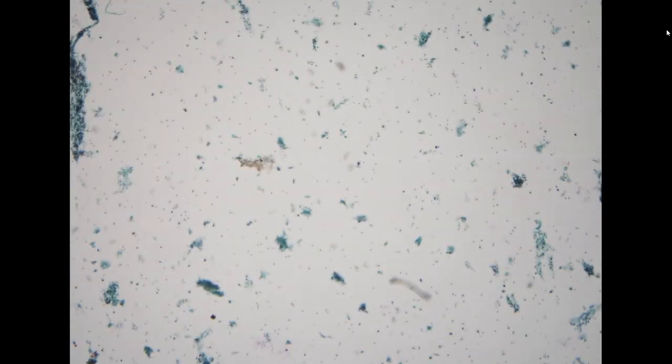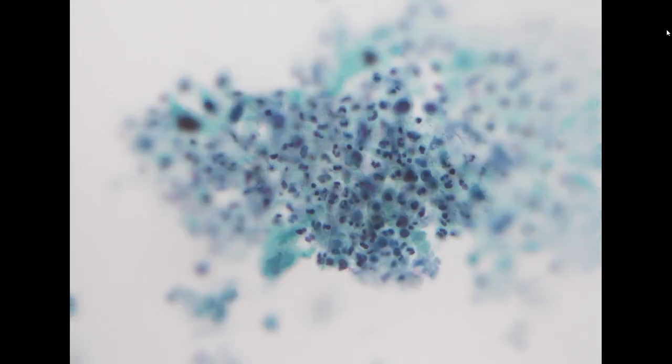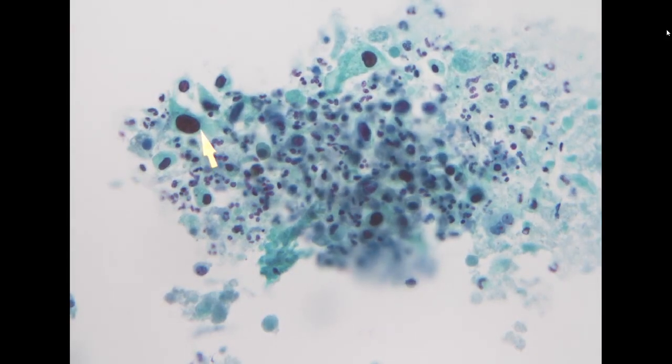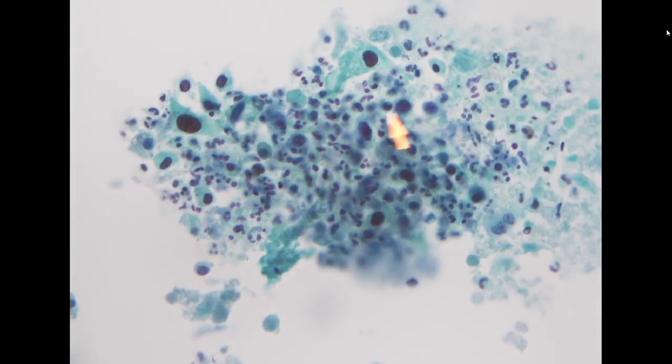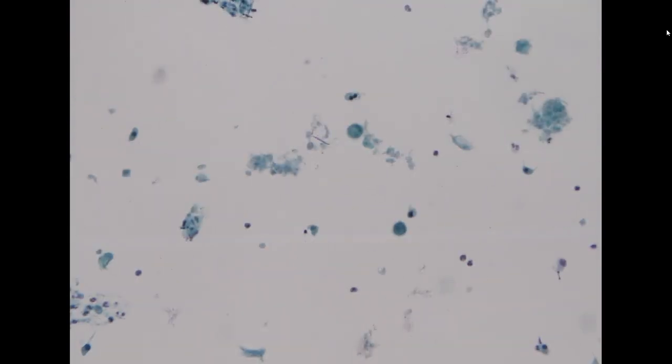So let's move to the fine needle aspiration. The first specimen that I want to show you is a thyroid aspiration. This is fairly unusual in a thyroid aspiration because usually we will see colloid. Instead, here we see necrotic debris and inflammation. And in here, you can definitely appreciate some angulated cells with cellular processes and very hyperchromatic nuclei, admixed in these inflammatory necrotic debris. So this is very unusual for thyroid aspiration.